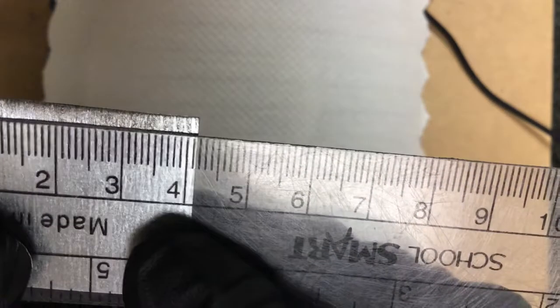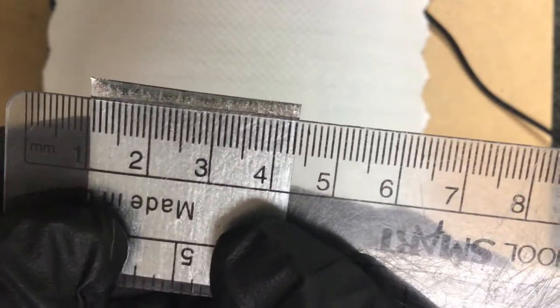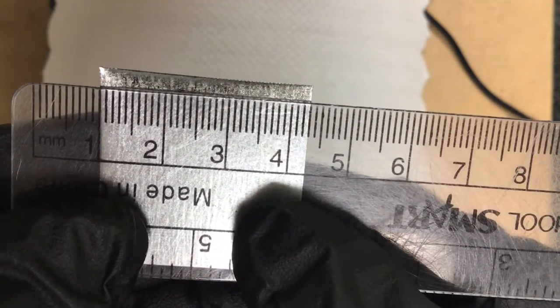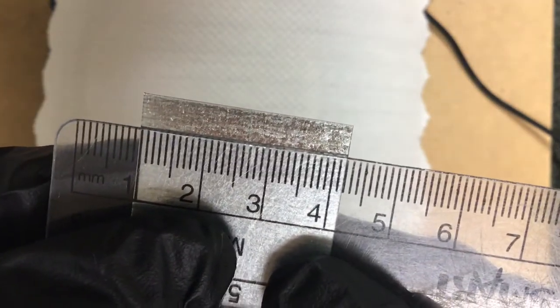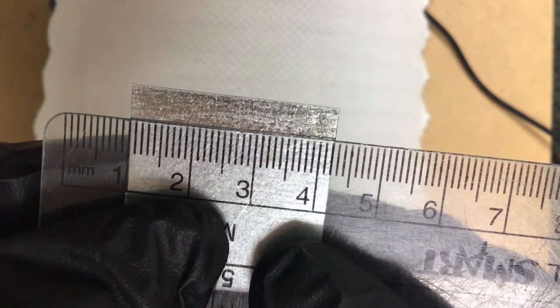All right, so that was for trial 1. Let's go ahead and get to trial 2. Let me get this on there first. Perfect. So that'll be the length and then width. Again, let me get that focused. Okay, so that's trial 2. Then trial 3.